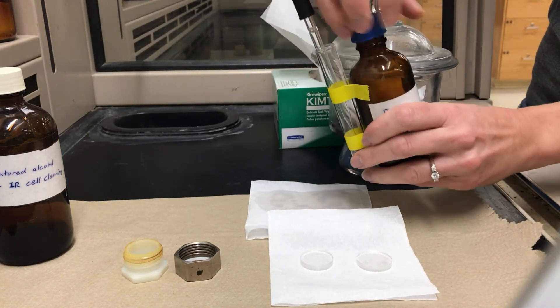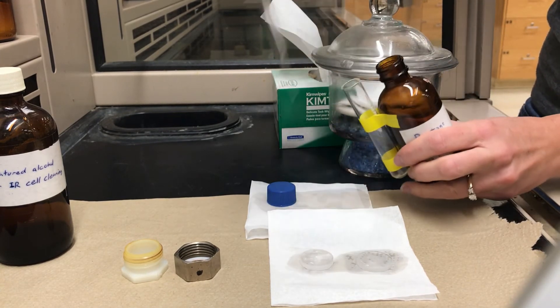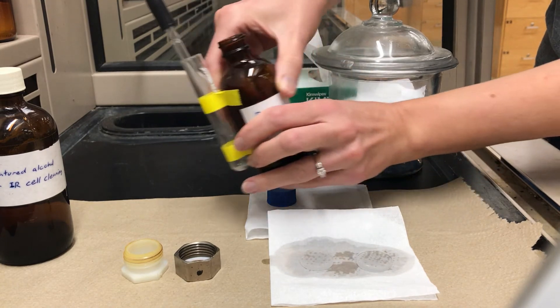So I lastly follow it up with pentane and pentane is a very non-polar solvent so anything that wasn't dissolved with the alcohol would dissolve with this.